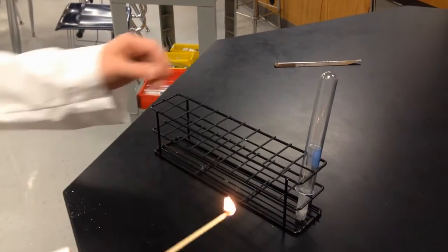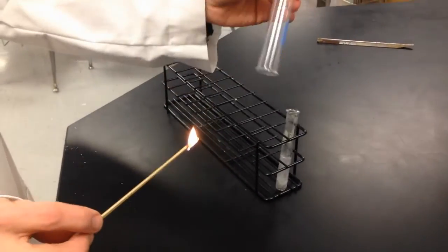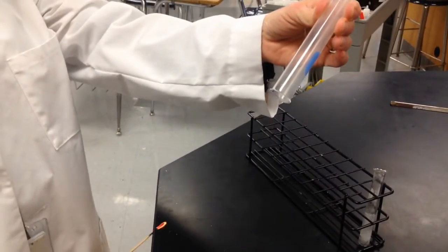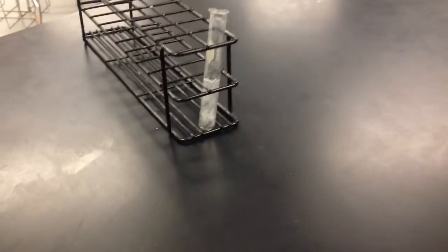Alright. Ready? Yep. Whew! Nice. Awesome. Alright. And look at it, still going.